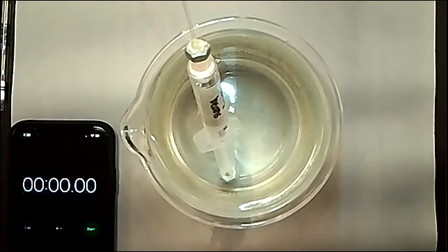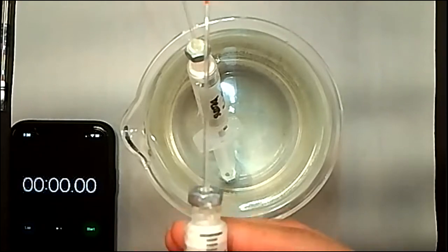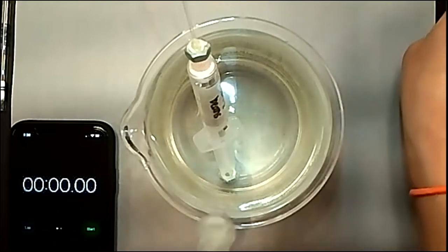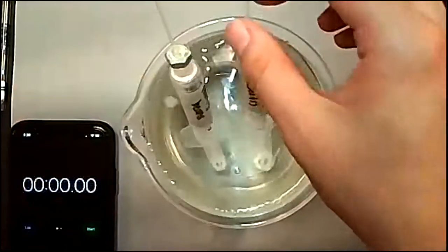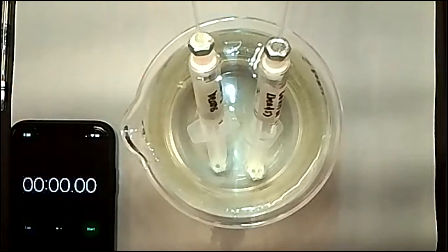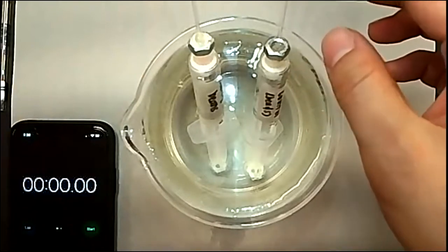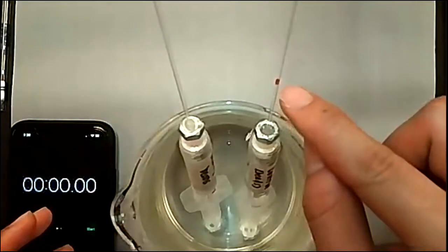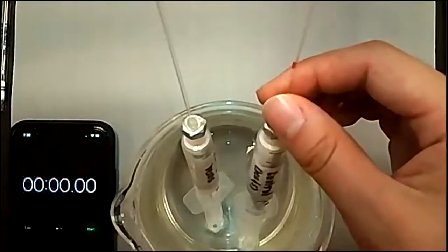and then I'm going to draw it into the tube about halfway. As you can see right here, it's about halfway down, or a little bit less than halfway down, since I am holding it right now, and it's going to get colder. So I'm going to put it into the bath, see where it settles, and then right before, I'm going to mark where it is. As you can see, the water bath is a lot colder, so it actually moves down a lot further.